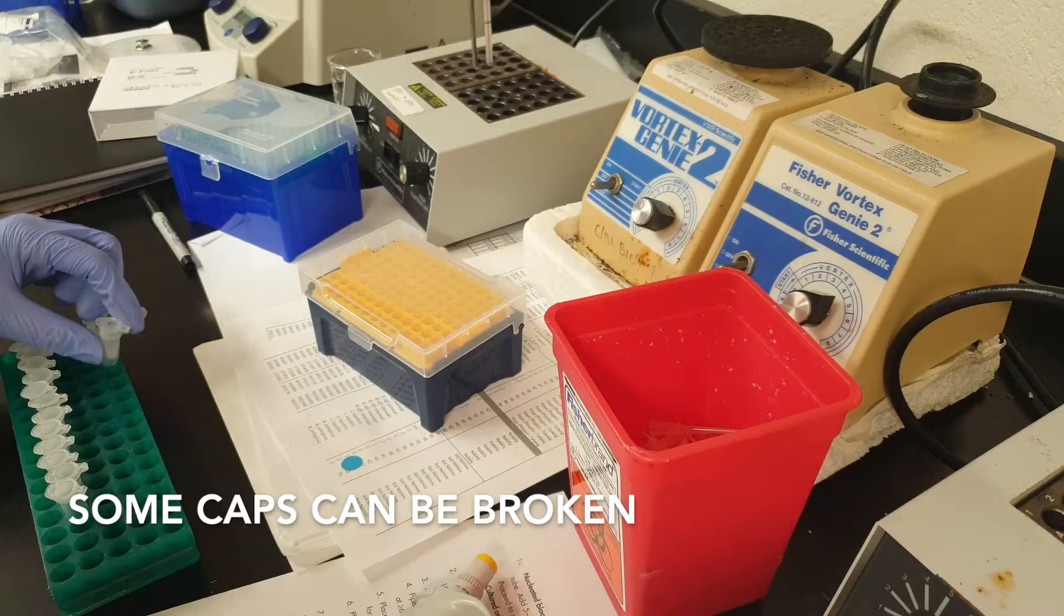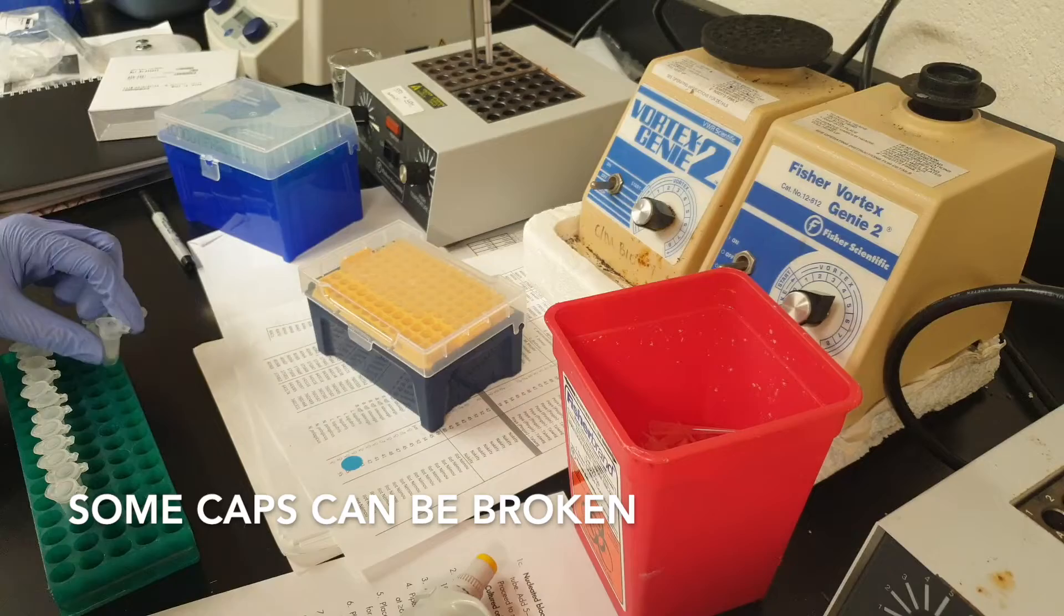Some caps can be broken at this stage; just replace them with new tubes. Once you're done, transfer all of your solutions into new tubes that are labeled and store your DNA extracts at minus 20 degrees Celsius.